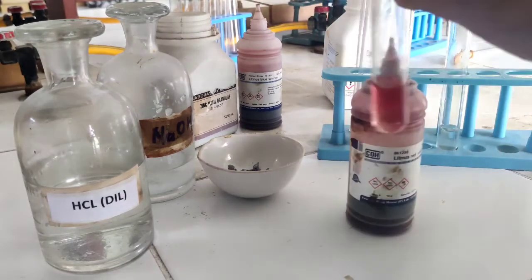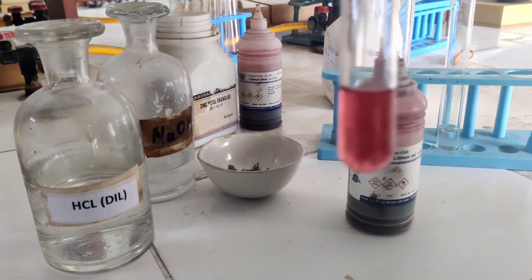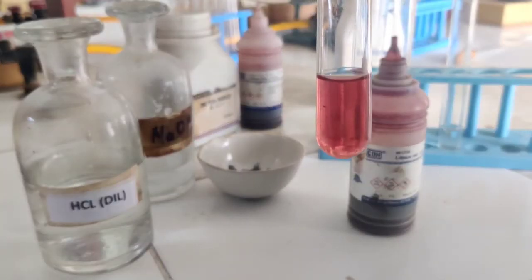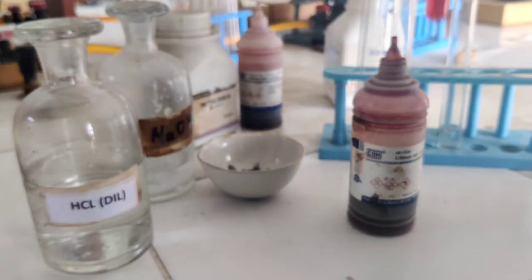You can observe the color change here — a red color is formed in this case, which suggests that it is acidic in nature.